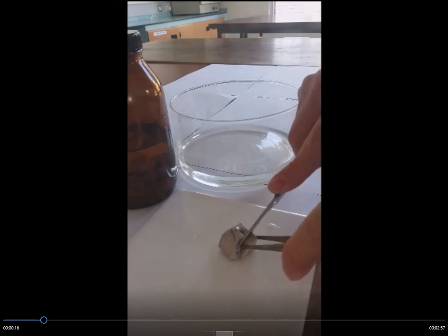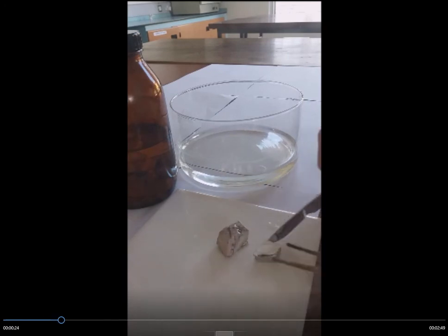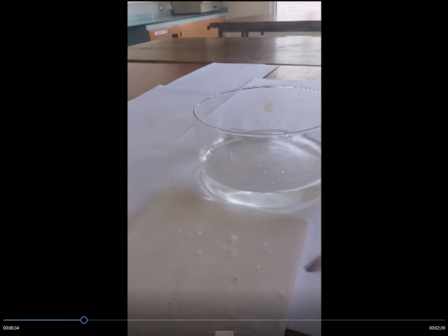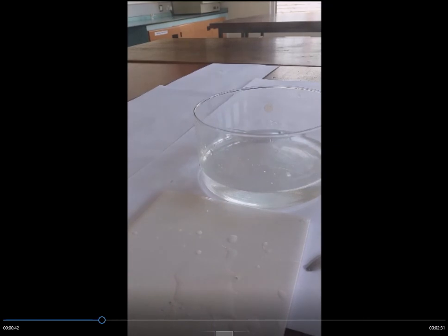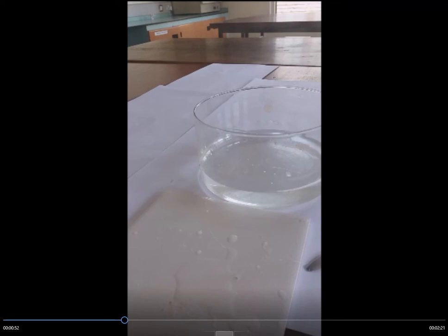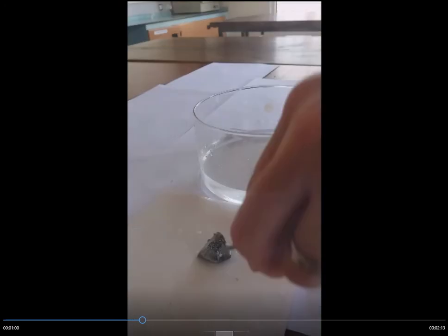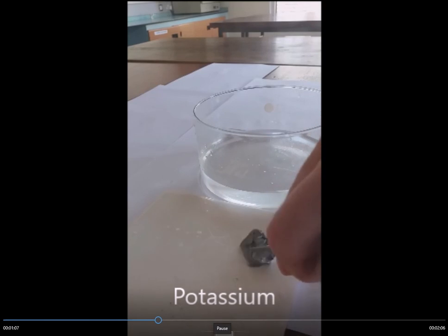Sodium is stored in oil in the lab to stop it reacting with oxygen. When freshly cut it is a shiny metal. A tiny piece is taken, the oil is removed, and it's placed into cold water. If you listen carefully you can hear hissing — that's hydrogen gas being given off. The sodium zips across the surface, turns into a little ball because the reaction is so hot, then floats, gets smaller, and disappears.